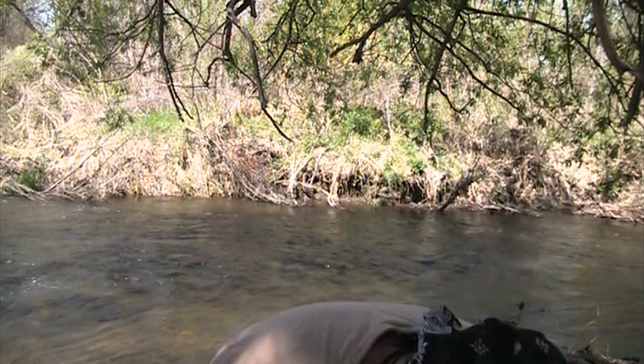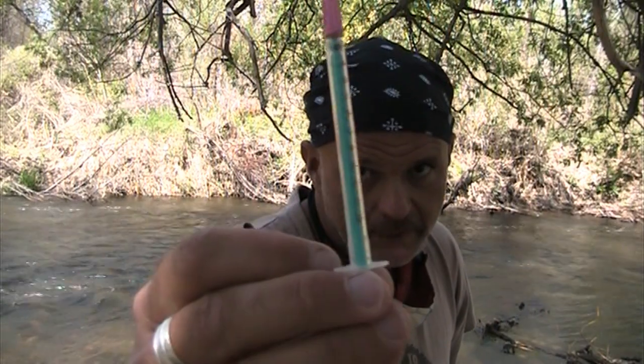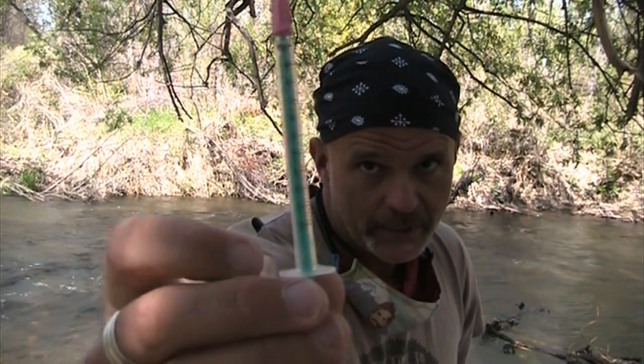One thing I like about this kit is it's got a safety cap, so, you know, someone like Alex is not going to spill it. The last thing we're going to do is start titrating. For teachers, this is where you got to guard them like hawks. This kit has a syringe, and if you look carefully, it's got numbers that go backwards.